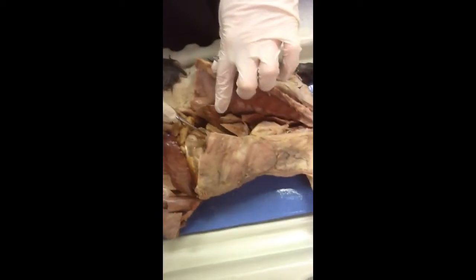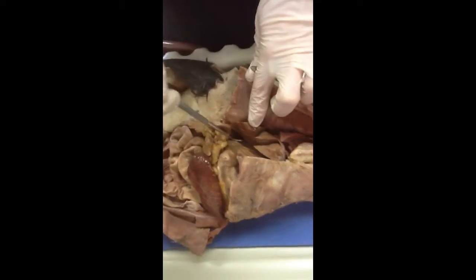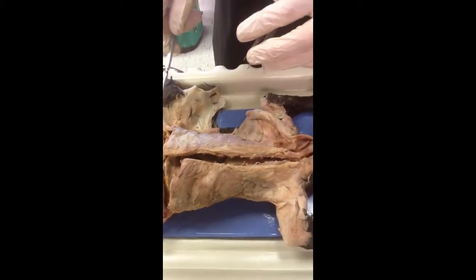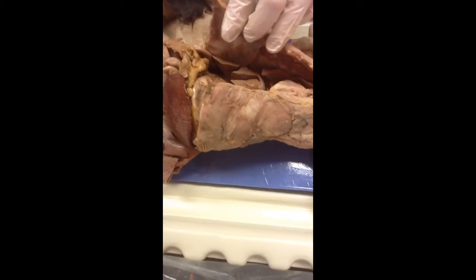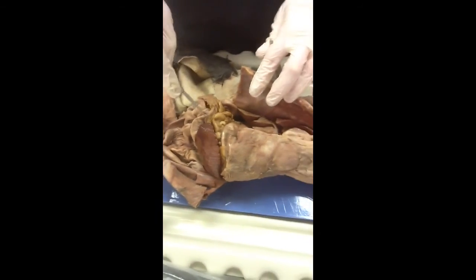Okay, so under there's the spleen and the gallbladder right back there. Where? Okay, they're right back here. Yeah. Pancreas. The liver's right there. Yeah, the liver's there, and the pancreas is down behind the heart area and under here. And the peritoneum is the lining of the abdominal cavity, so it's just like what would be here. You got the protective tissue right here, and that's all for the digestive system.